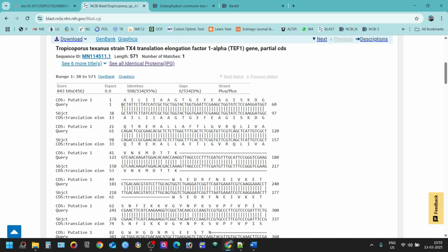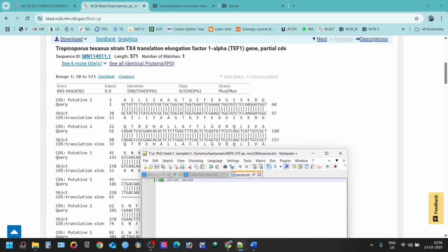So you have to count from here. For example, this is your one sequence. It is mentioned here, but you don't know what is this, what is this position of this G. So you have to count from here. For example, this is 121. You know this is 121, then 122, 123, 124, 125, like that. You have to count up to this, because from here it is your introns, the non-coding region, which is starting from here. So you have to count up to here, and I know this is actually 144 because I've already counted.